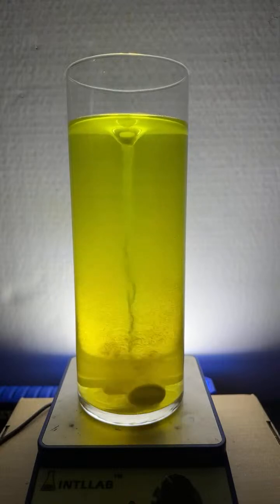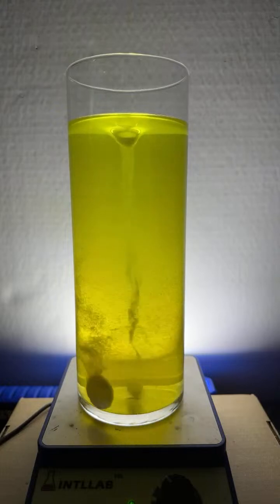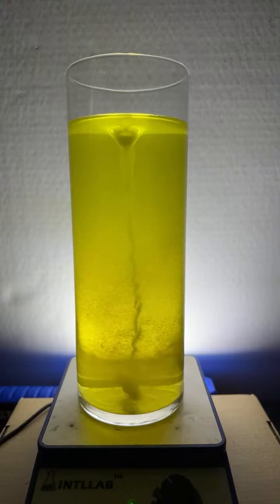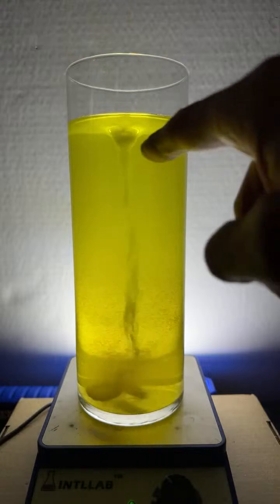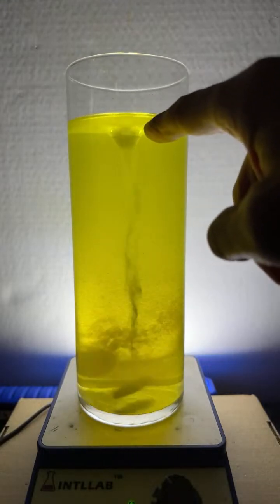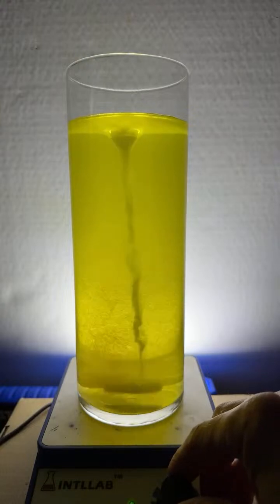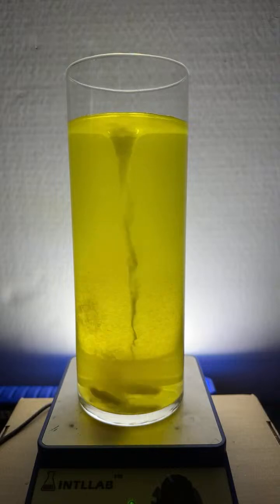But I want you to check out where those bubbles end up. See how they kind of get caught in the vortex? Can you see that? The bubbles kind of find their way to the vortex. You can easily see it up here, right up there at the top. They kind of actually get caught in the funnel. I'm going to turn this up just a bit more. Yeah, there's a lot of bubbles in there.